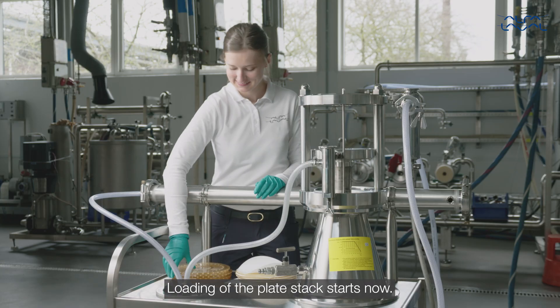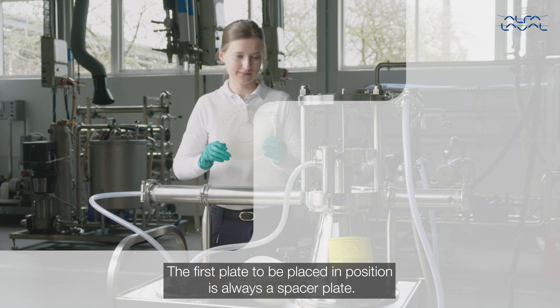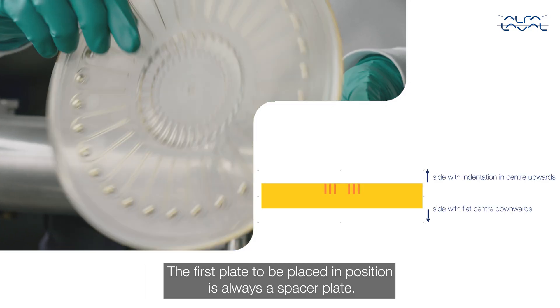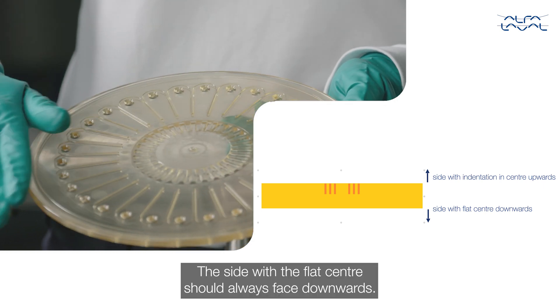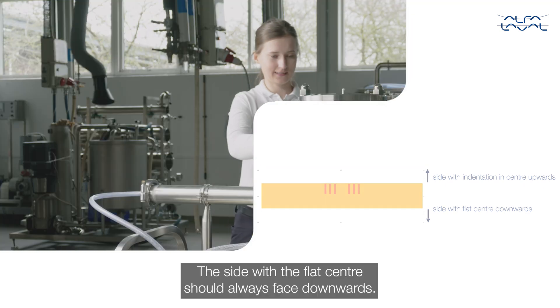Loading of the plate stack starts now. The first plate to be placed in position is always a spacer plate. The side with the flat centre should always face downwards.